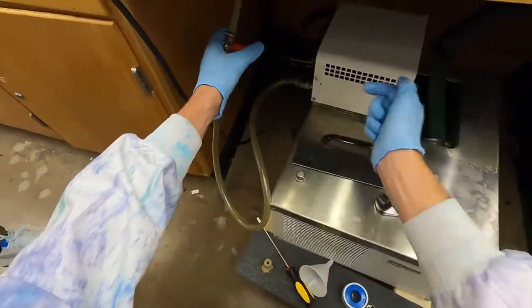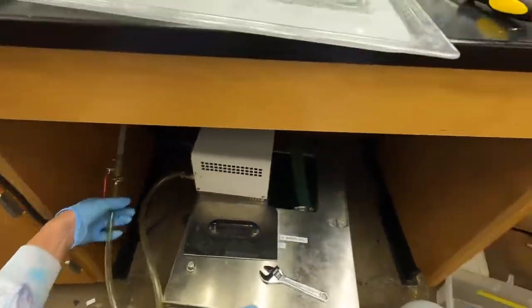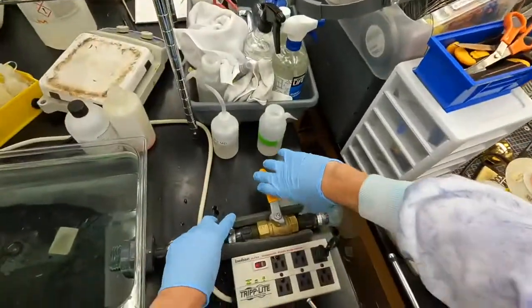This is where it'll be spraying out the cold water, so this has to be open so it can have somewhere to go. You open up this valve, and then up here at the top you're going to open up this big return valve way.